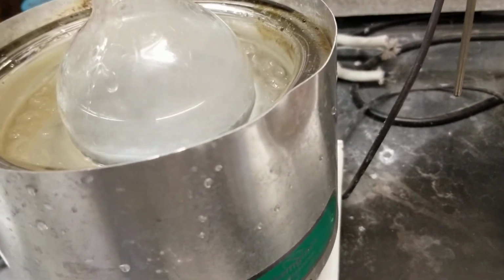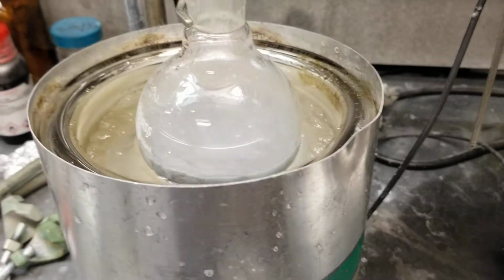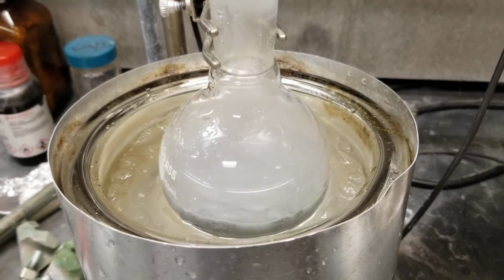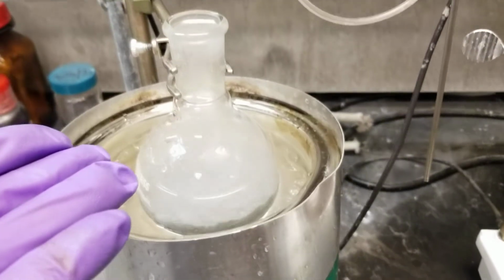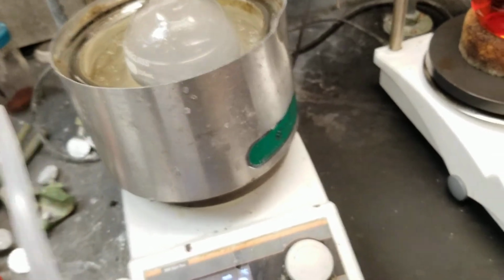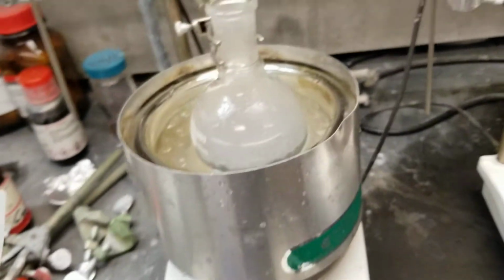Fortunately, in this case, we're not having big trouble, but for a lot of people, especially when they're starting out, not being aware of these things and not controlling them can create issues and messes in the lab. You can imagine if we didn't control the rate that we quench this at, if we didn't have it on ice, then we would end up with all this material on the ground all around, and you just lose that material, and it creates a big mess that you have to deal with later.